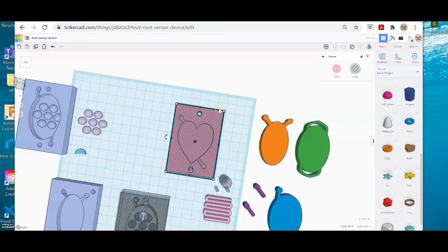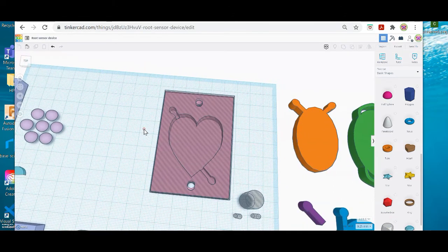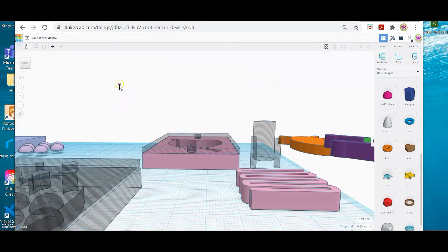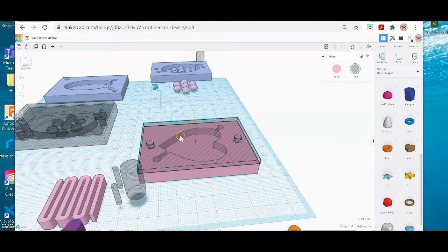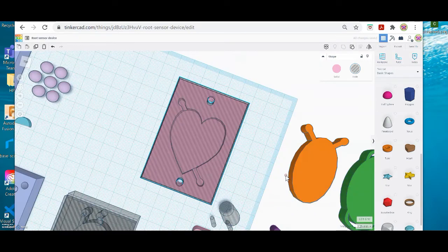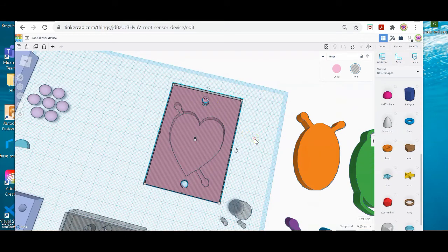And again, I often use my arrow keys to move things up and down. Okay. I'm going to go sideways, so you want to go to all different directions. I'm going to select my lid again and just move it. Okay, so my holes are not perfectly aligned, so I will fix that in a moment.